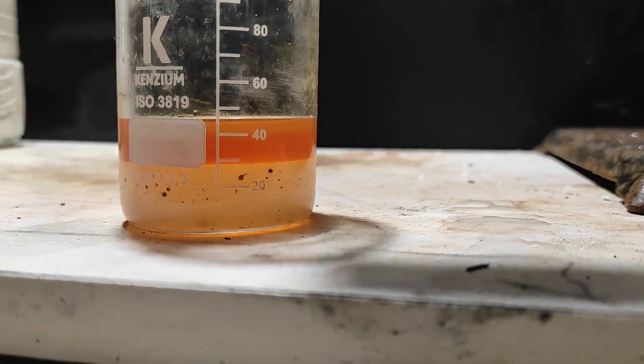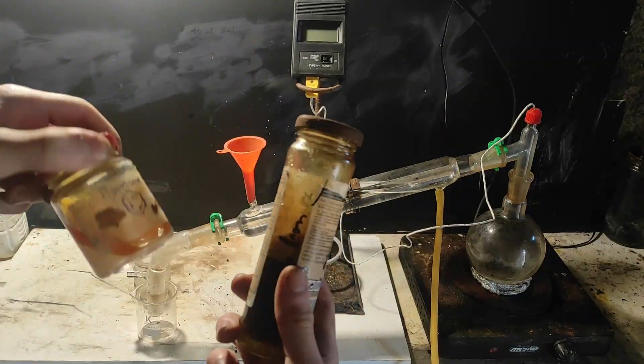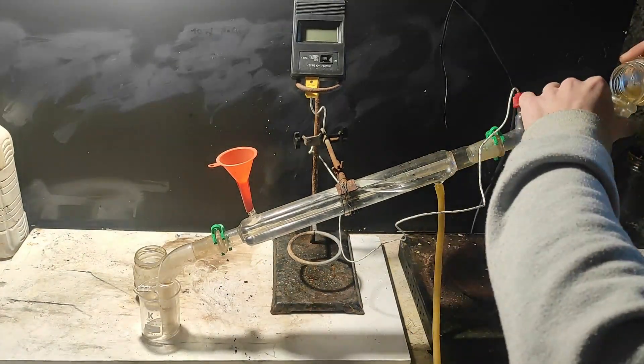In the end, I recovered around 50 ml of crude benzene oil, so I discarded the water layer, and combined the benzene with the other one made from the terephthalate, and put everything in a flask.